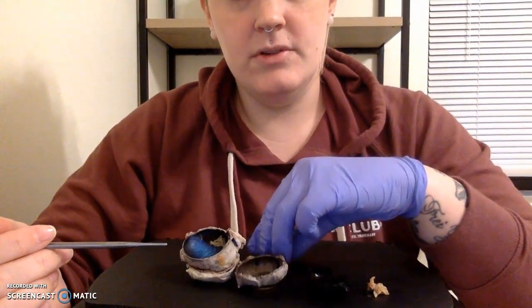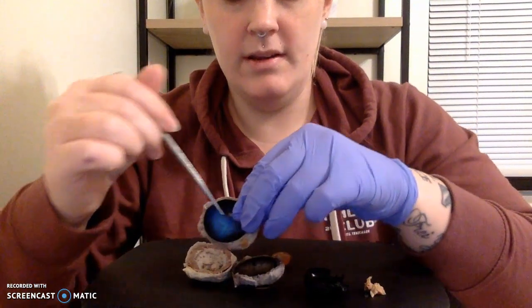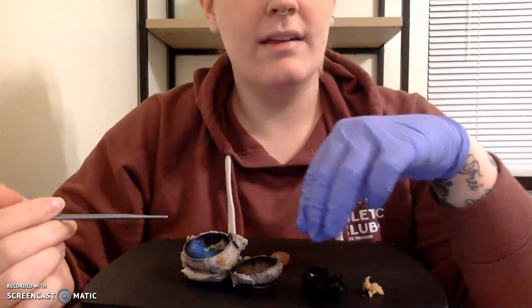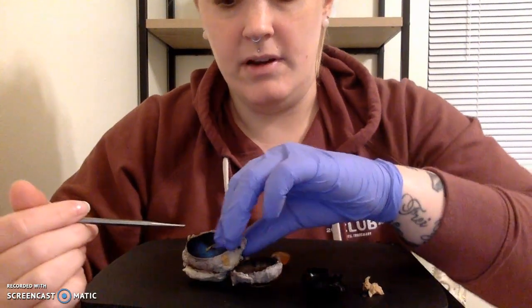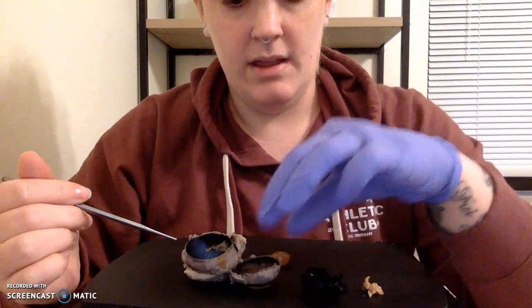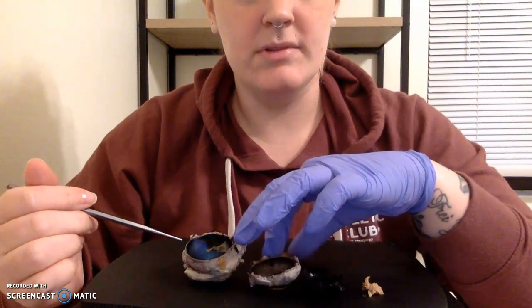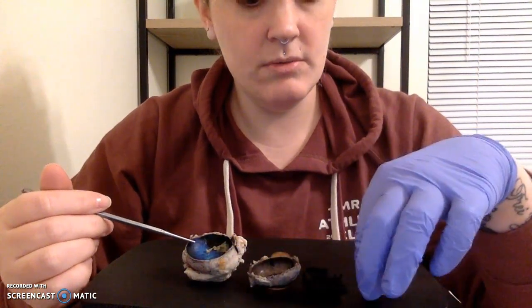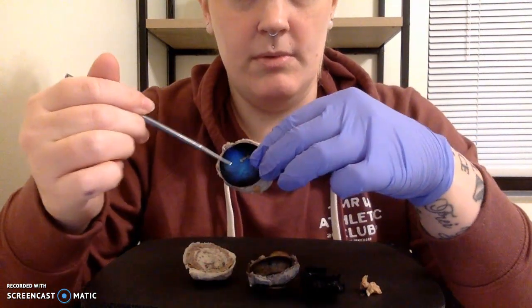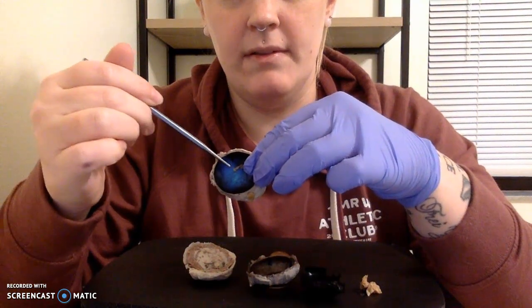So then our vitreous humor is right here in this area. It sits right in front of the retina, and it is a gelatinous substance that you would find within the eye. Unfortunately, I think I removed it. If I had it, it might have gotten mixed in with some of the preservation features that were used. Whether or not I can see it, I'm not super sure, but it will be right in here filling that cavity.